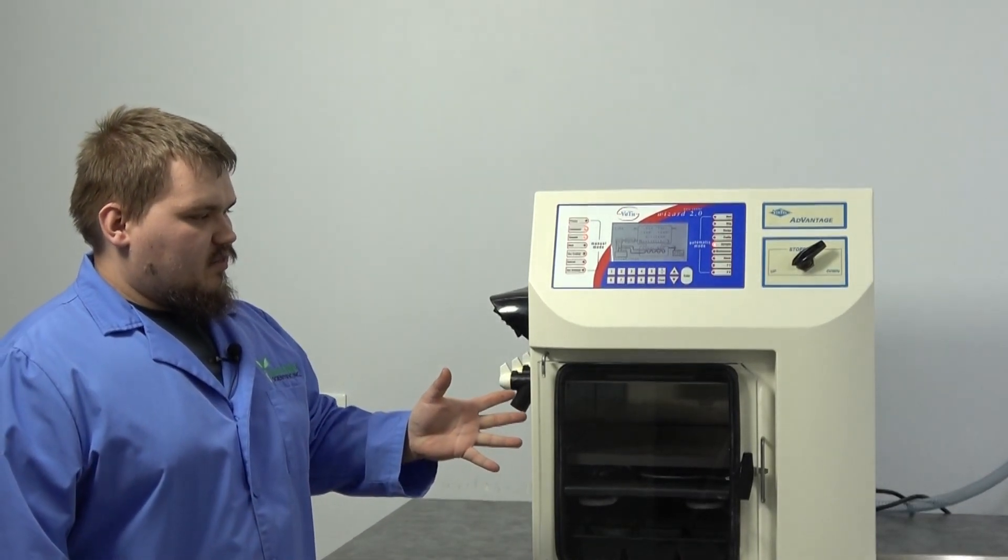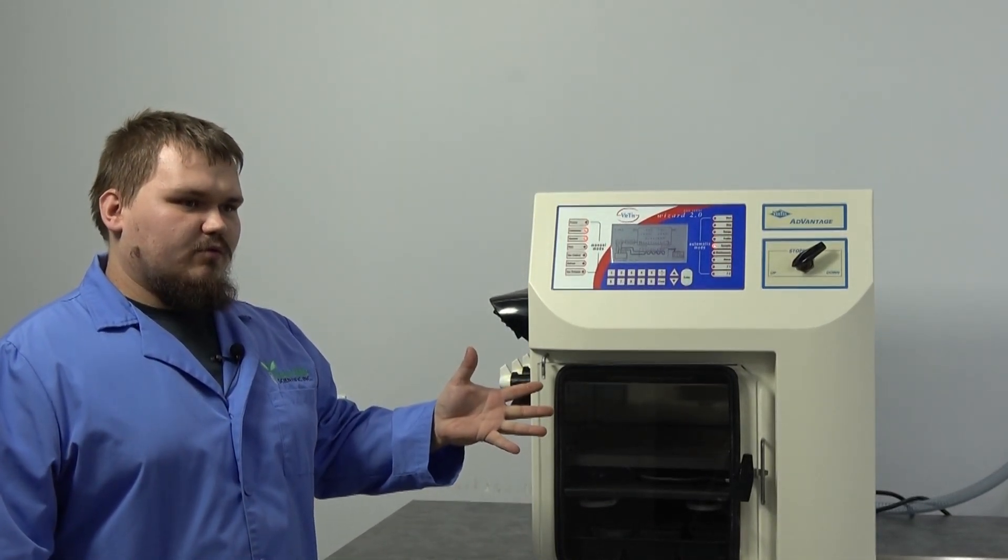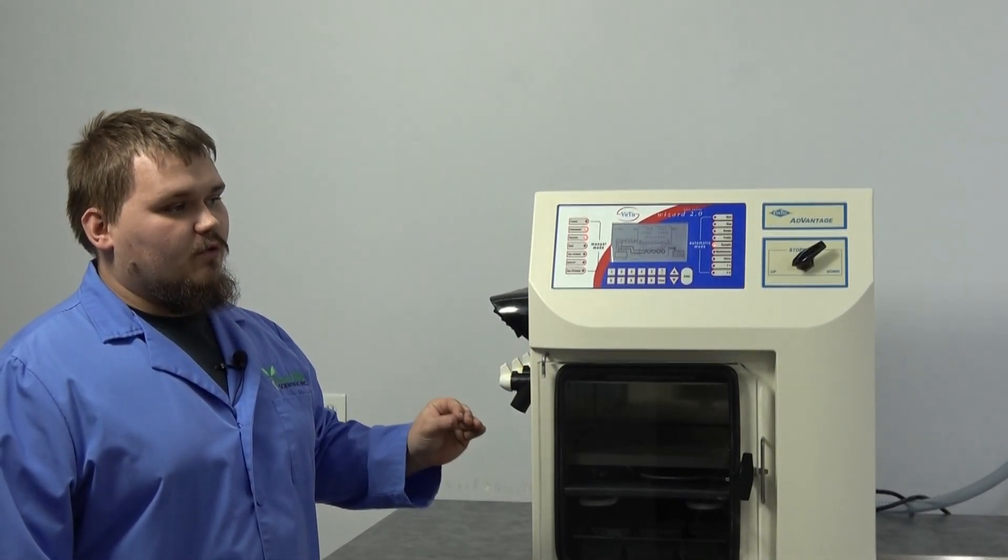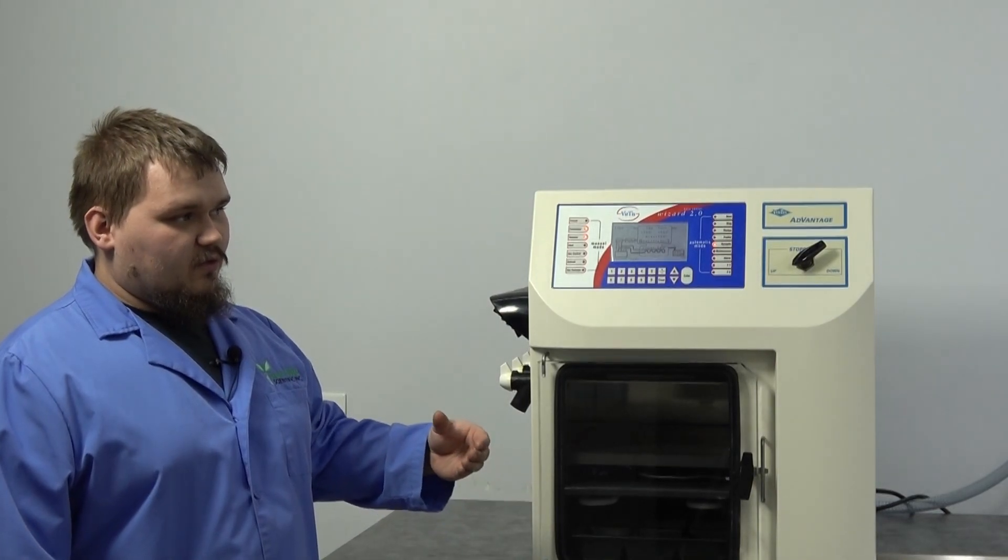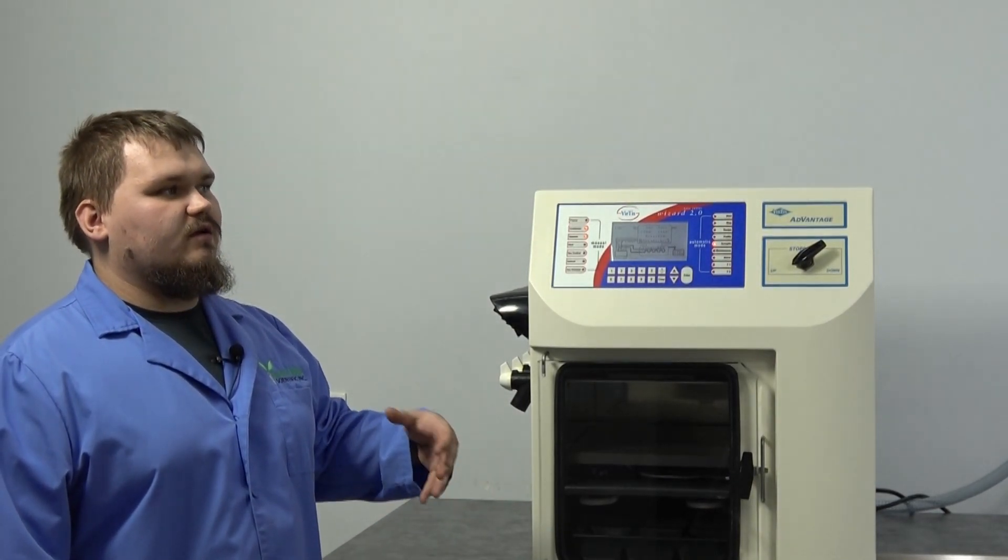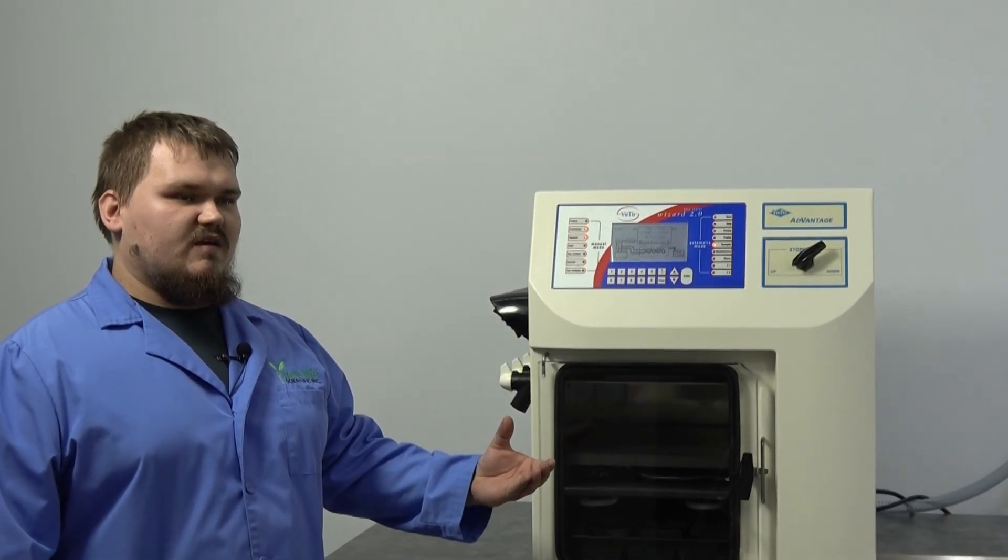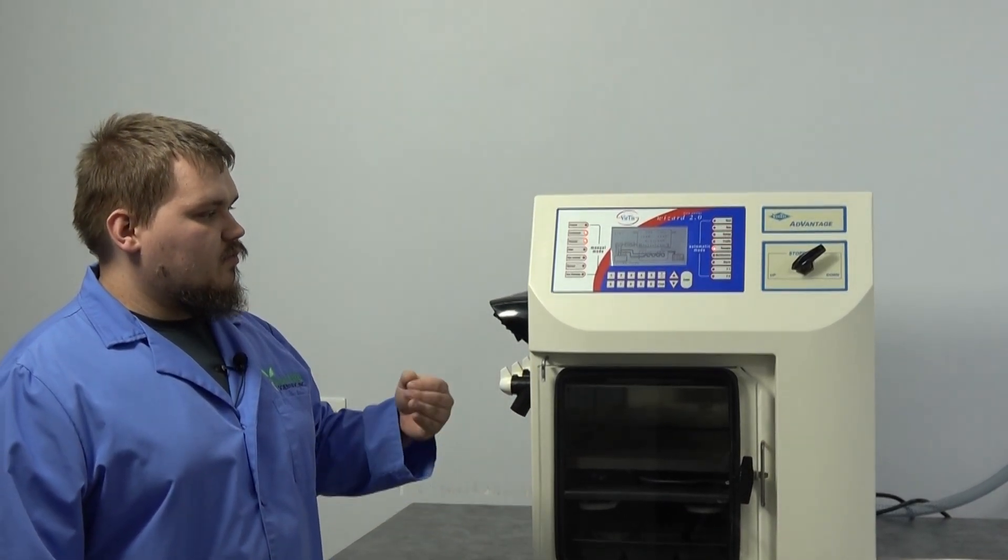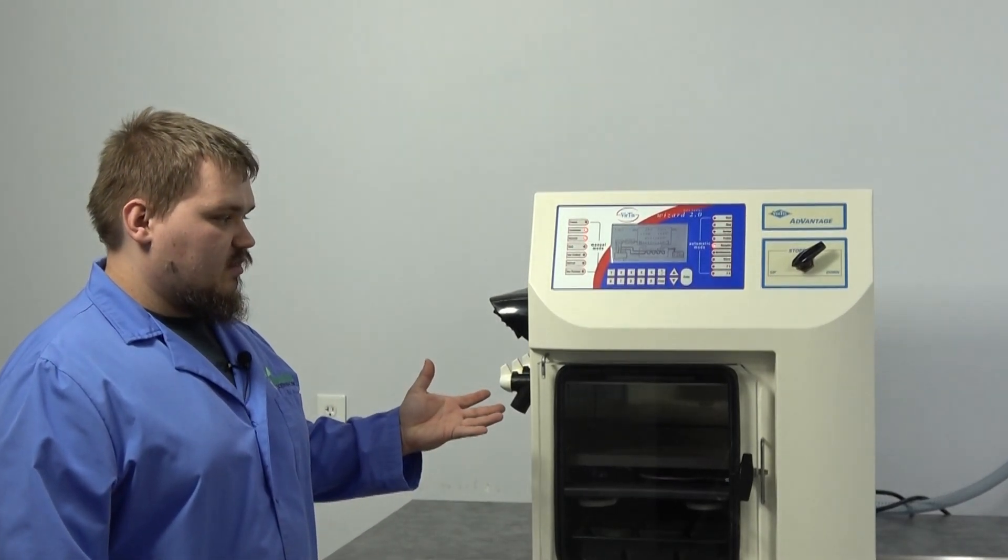With the vacuum pump starting up, you're going to notice for the first couple of seconds it's going to be noisy. That is perfectly normal. After it gets done being noisy, just keep listening. If it keeps continuing being noisy, you've got an issue either with the pump or you might have an air leak somewhere.